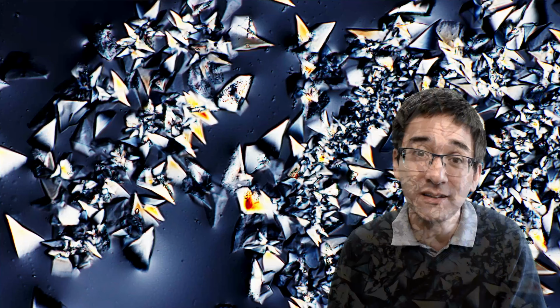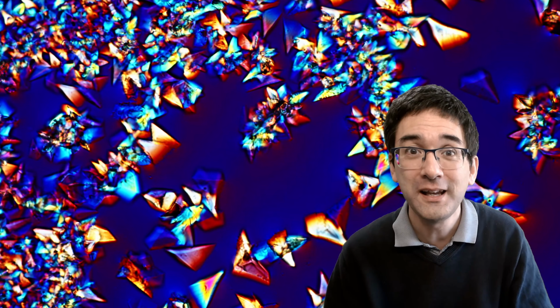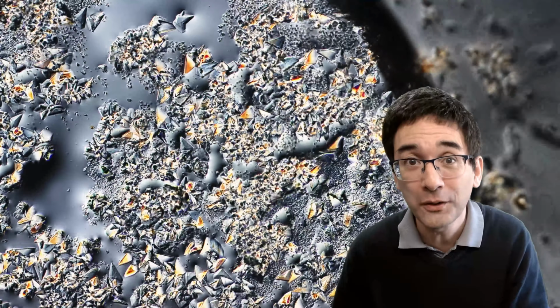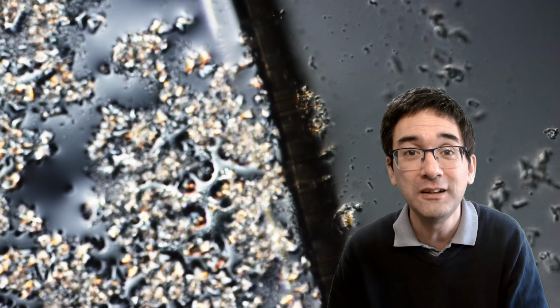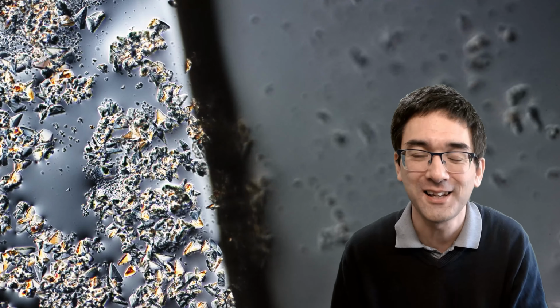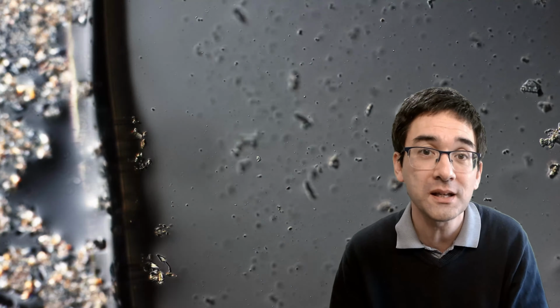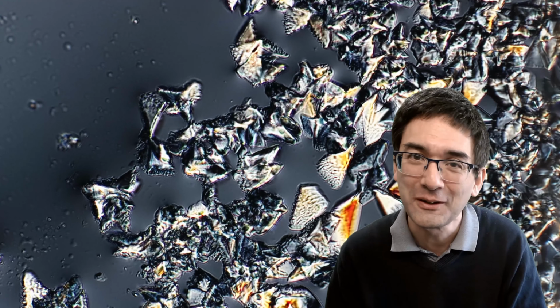Yeah, so you see that this is indeed a possibility, but now the thing that you've all been waiting for is this look from the side. This is now some more Coke that I added, and you can see that the Coke starts to dissolve the individual crystals again. Yeah, so the destruction of art, as I call it. However, after a couple of minutes, the Coke becomes saturated, and then the crystals don't dissolve as quickly anymore, and it takes a much longer time.